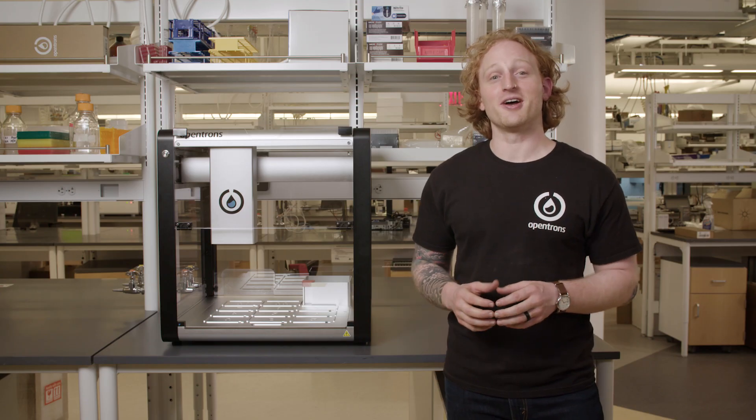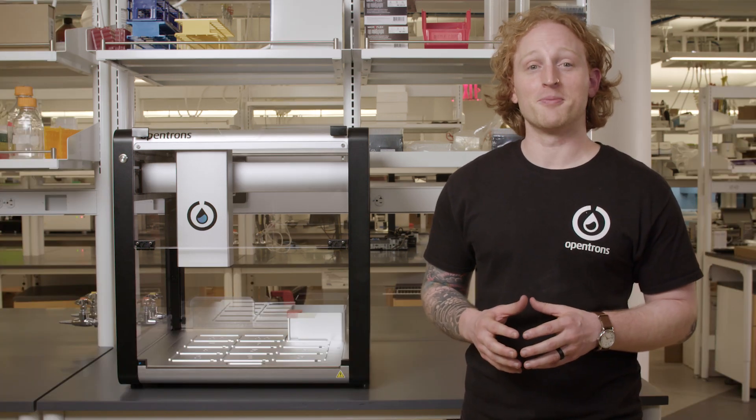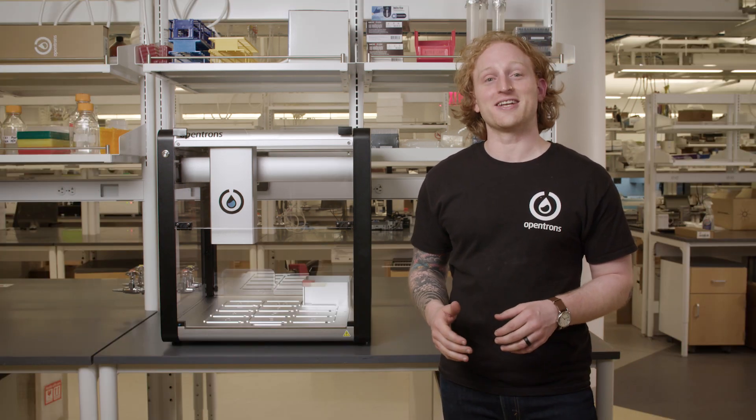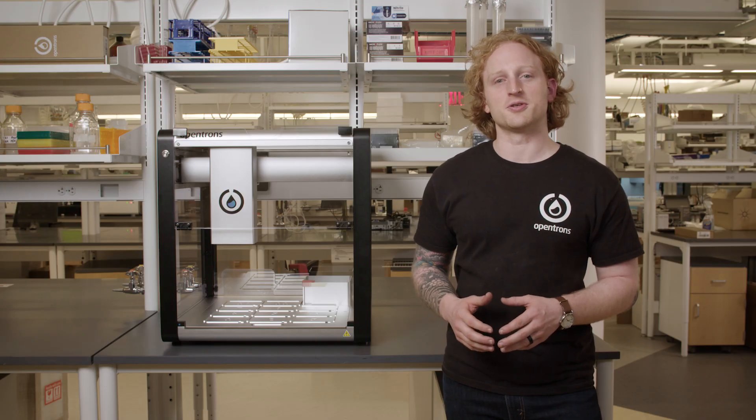This concludes our video on unlocking the OT2. Thanks for checking out the second video in our From Box to Protocol series. Now that I have the OT2 unlocked, I can start to get to the fun stuff. In the upcoming videos, I will be going through installing the app and attaching the Opentrons pipettes.